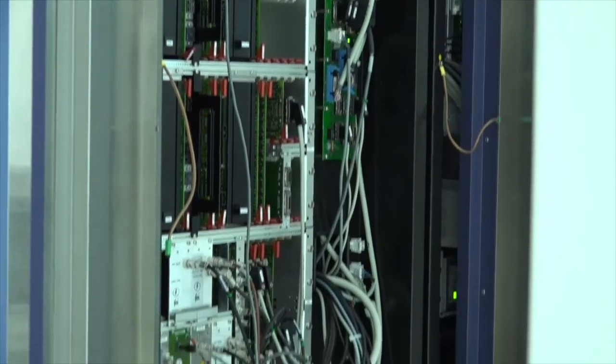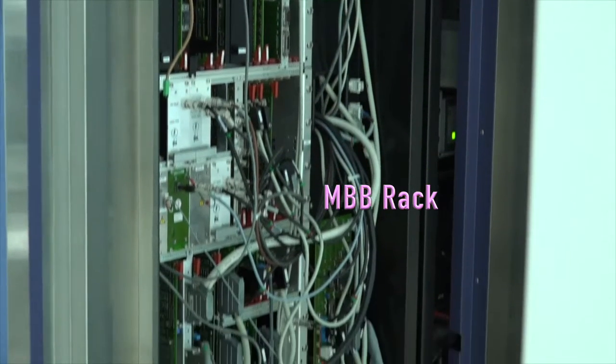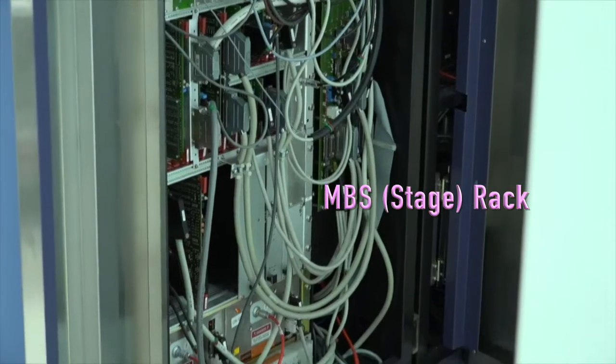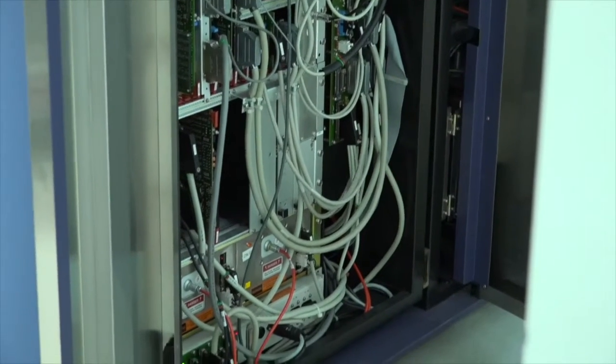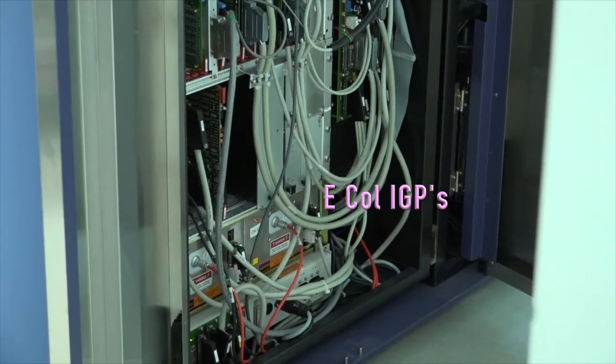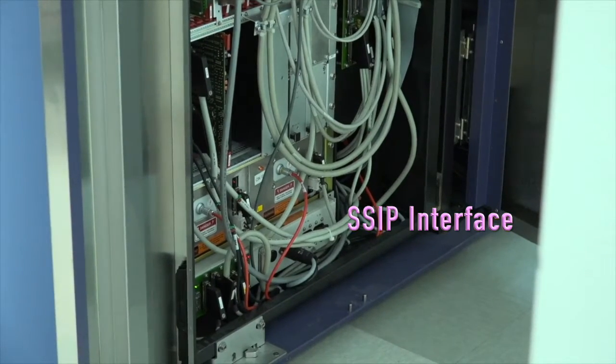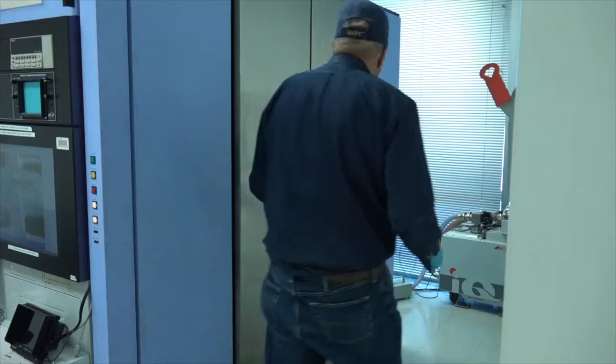There's 1, 2, 3, 4, 5 racks, plus the IGP power supplies. Then an interface box below that. See what you can see.